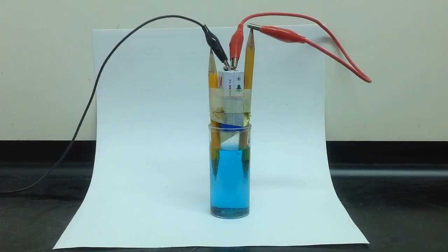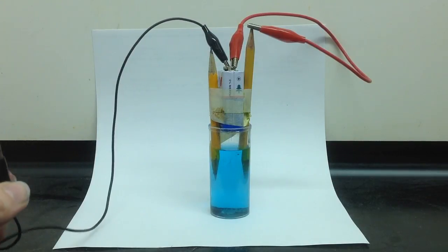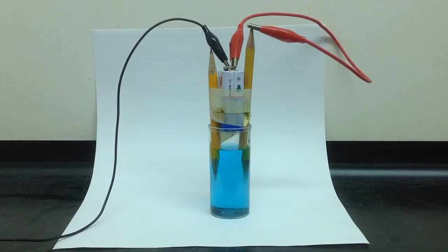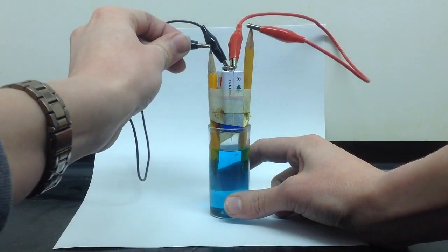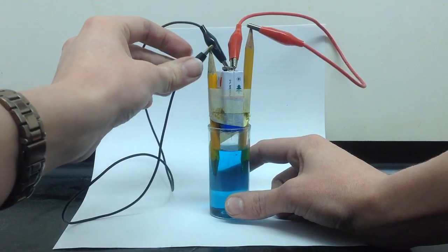And then, I'm going to complete the circuit by attaching it to my last electrode. Now, when I connect this, let's start making some observations of what happens in my solution.